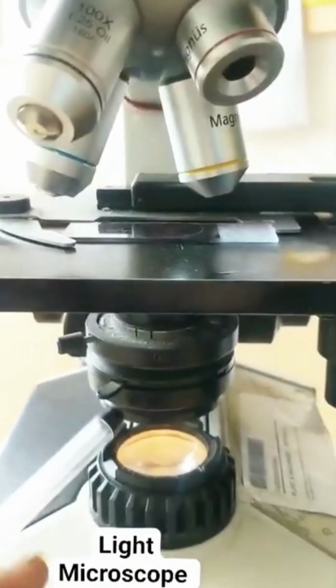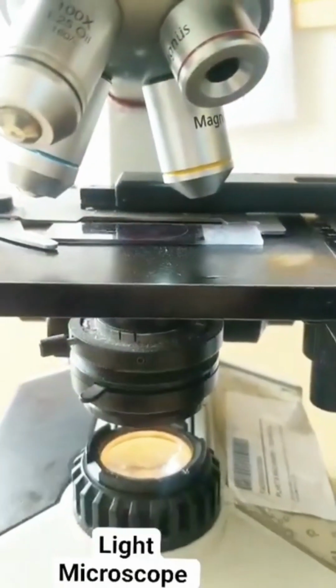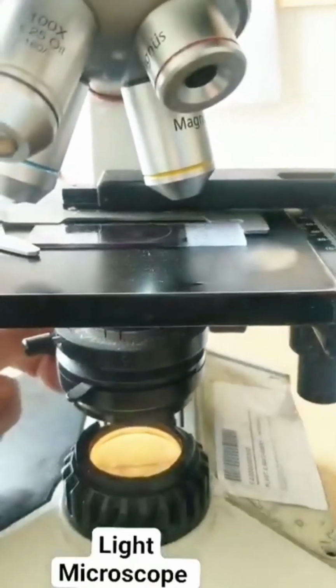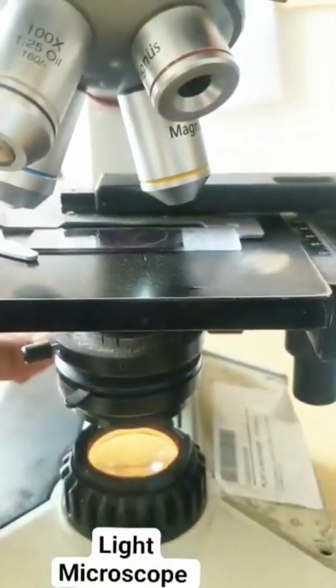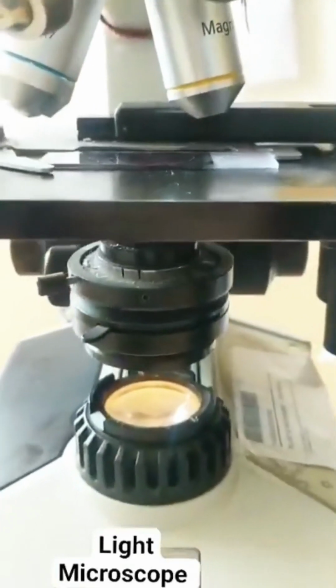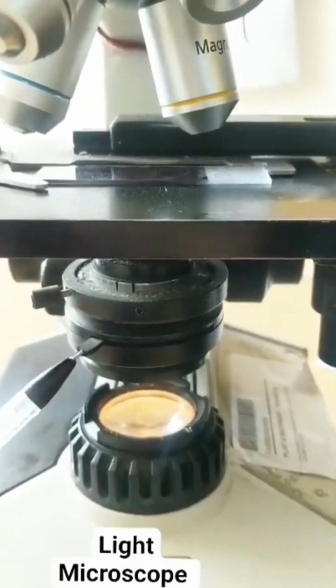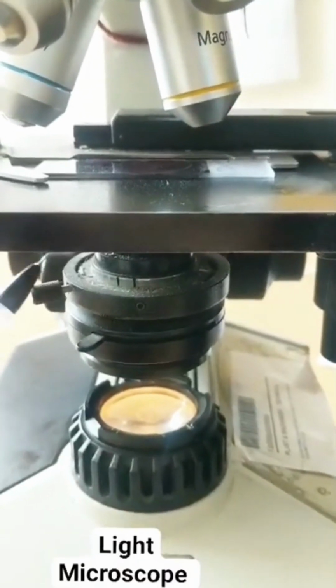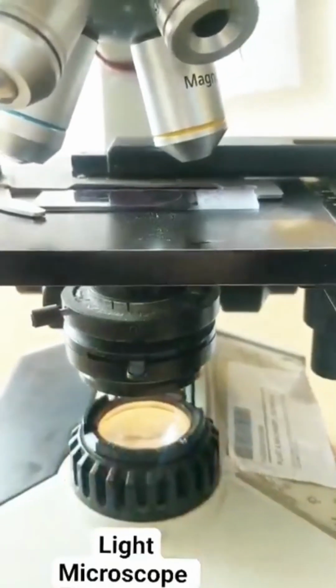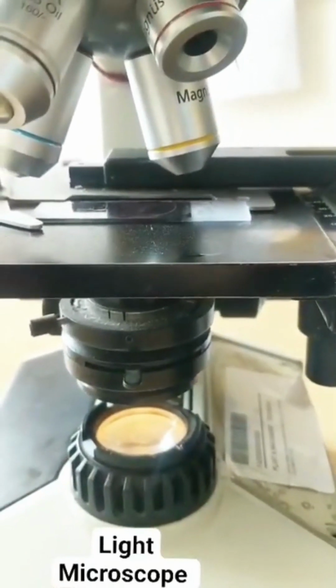The light passes through this particular part. This particular part is the condenser. See, I can move the condenser up and down. And with this knob, I can adjust the amount of light. So this becomes the iris. There is an iris present. So this whole thing is a condenser, and there is an iris which will help me regulate the amount of light entering.